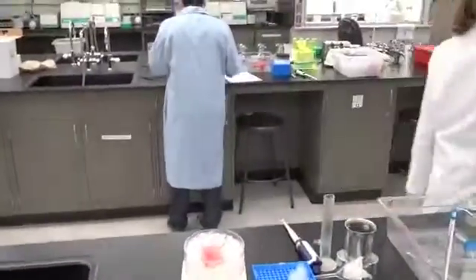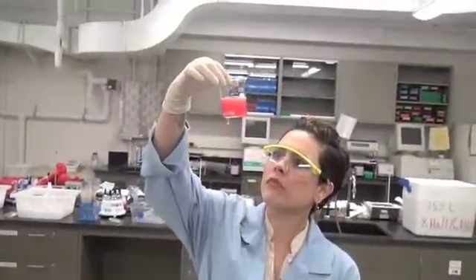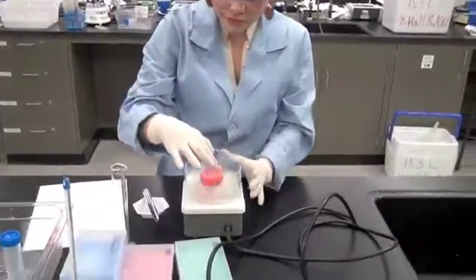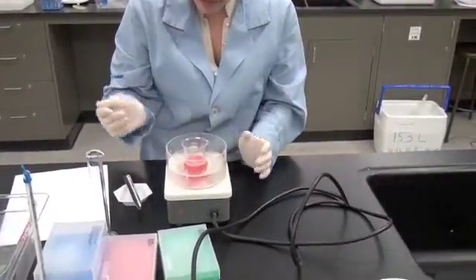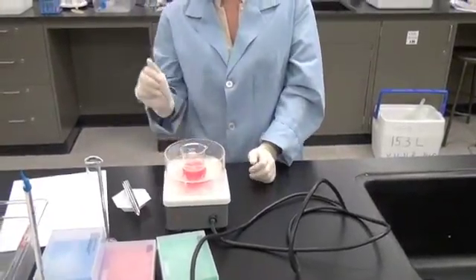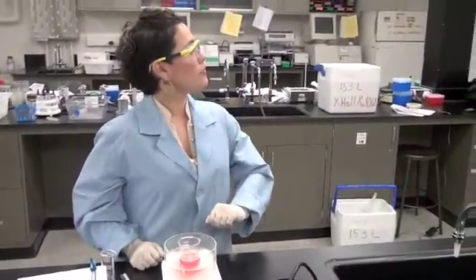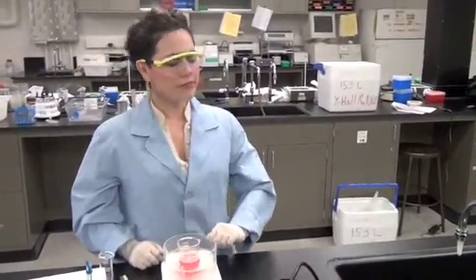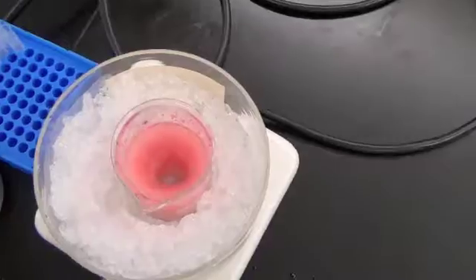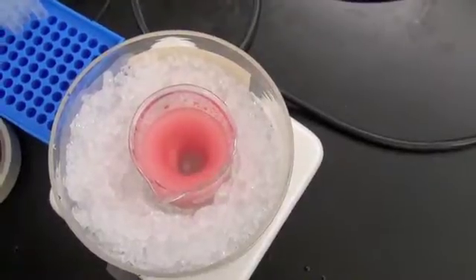Freeze! What is she looking for? Biochemist Dicer is actually looking for salt crystals that might be undissolved at the bottom of her beaker. The solution may actually appear cloudy, but that's the aggregates that are primarily comprised of fats and lipids. Undissolved crystals would be at the bottom and look crystalline. She's checking to make sure that they're all dissolved before she lets the 40% saturated sample sit for 10 minutes on ice without stirring. Here's the Challenger's 40% saturated solution.